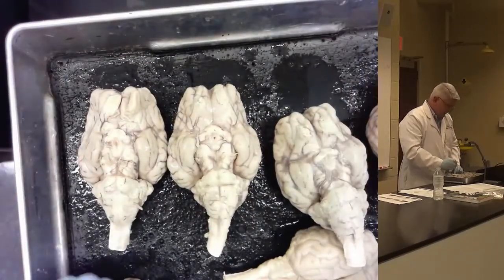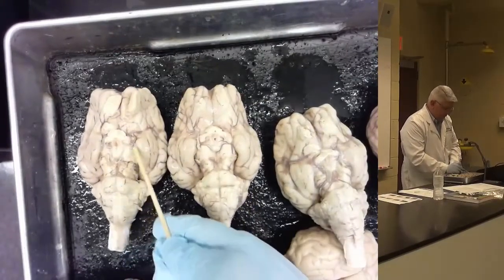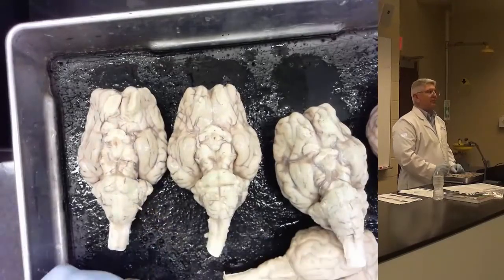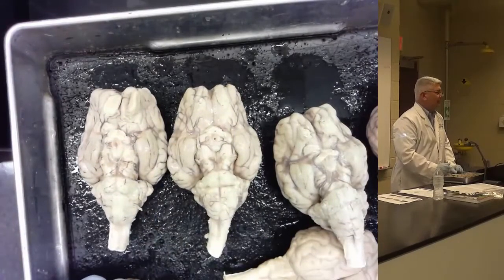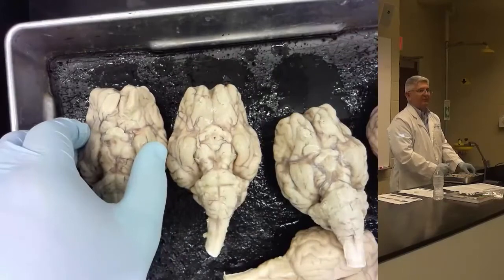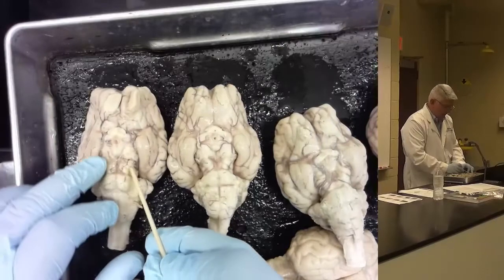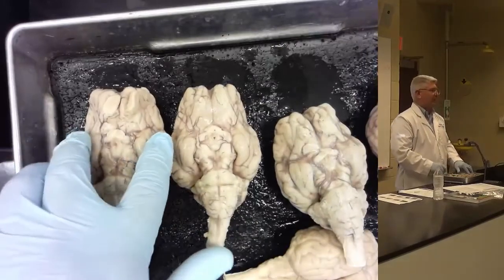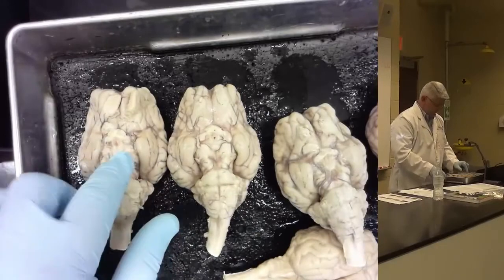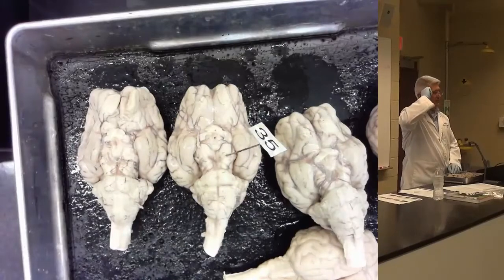All right. This big V-shaped structure, which almost has a rope-like or cord-like appearance, is called the cerebral peduncles. The word peduncle, it's a funny word, means connector. It connects your brain stem and spinal cord with your cerebral hemispheres. So it goes from the pons of the brain stem and carries the signals back and forth to the upper part of the brain. So this rope-like V on either side is the cerebral peduncles.